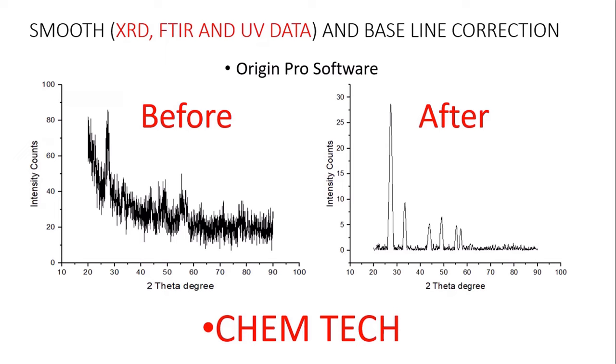How can we smooth the XRD, FTIR and UV data and how can we correct the baseline? Sometimes we don't get the data smooth, and peaks do not appear properly visible. Like I have XRD data, the peaks are not properly visible, we can't identify them, the baseline is not corrected, and there is a lot of noise. So we need to convert it into this form.